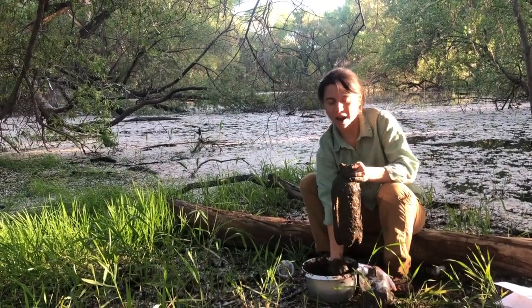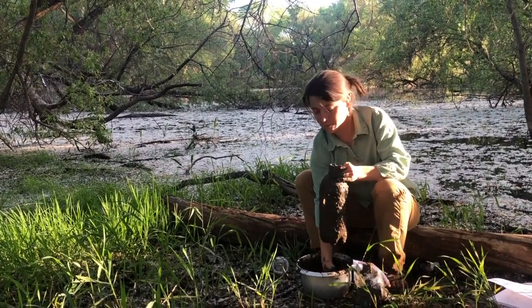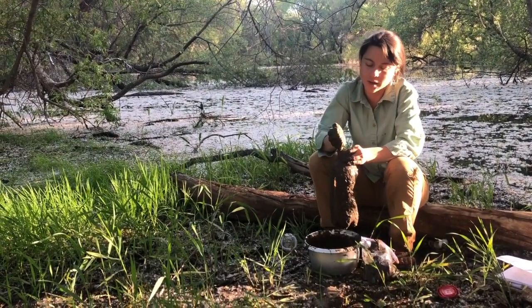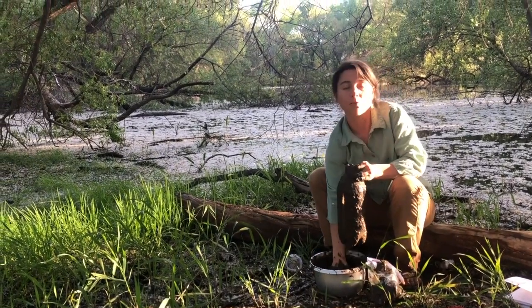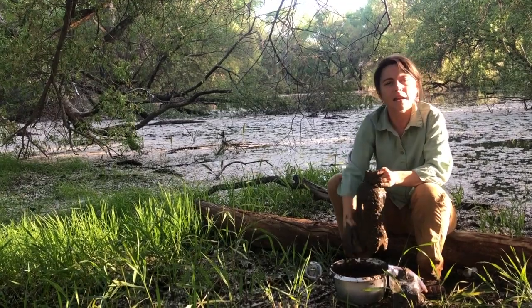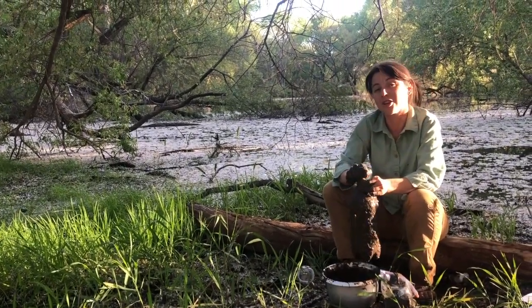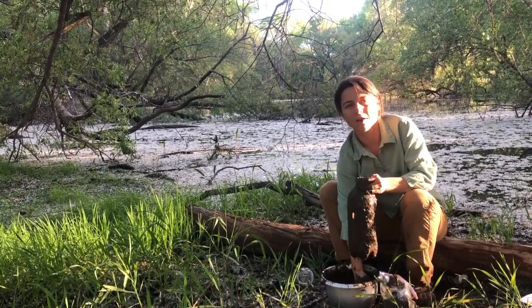Once we have our concoction, we can start to fill our bottle. And this can take some time, so be patient with yourself. You can add water to make it a little more liquidy, or add something that has a little more sand in it, and that'll help it flow a little better too. Remember, wash your hands when you're done, or wear gloves.